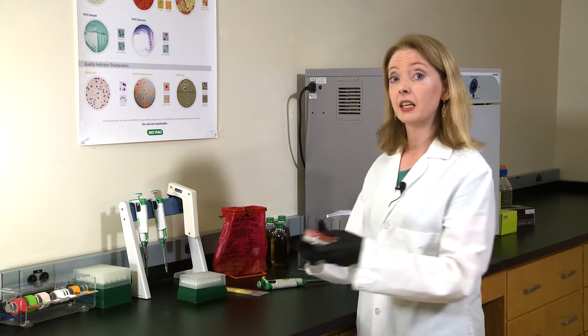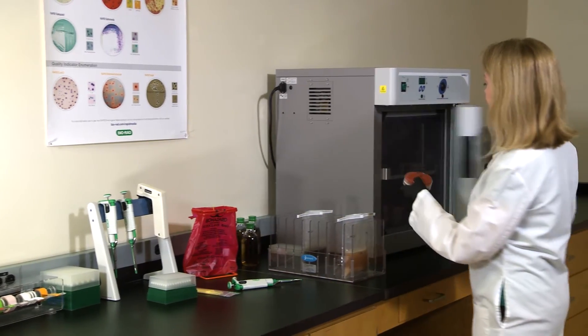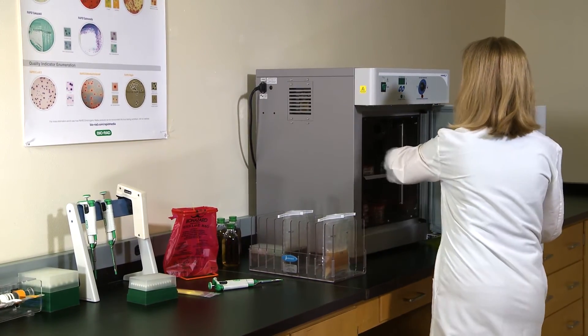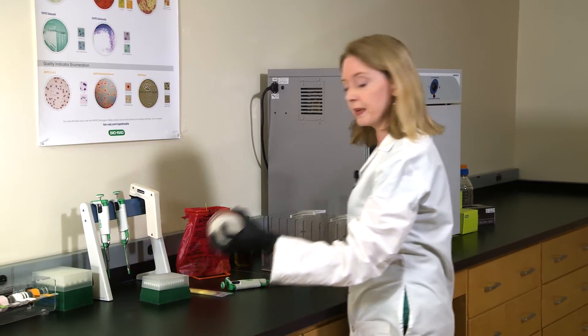Now place all plates in the incubator for 24 hours at 37 degrees. Luckily I happen to have some plates here that have already been incubated.